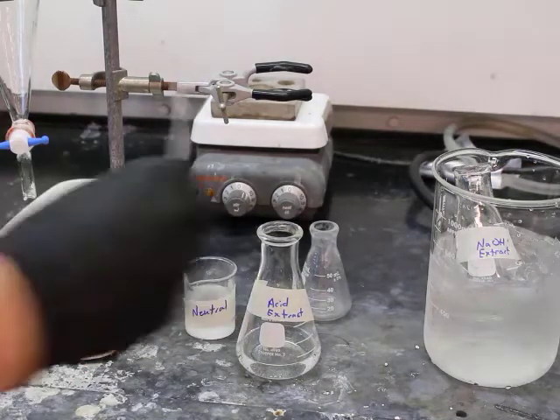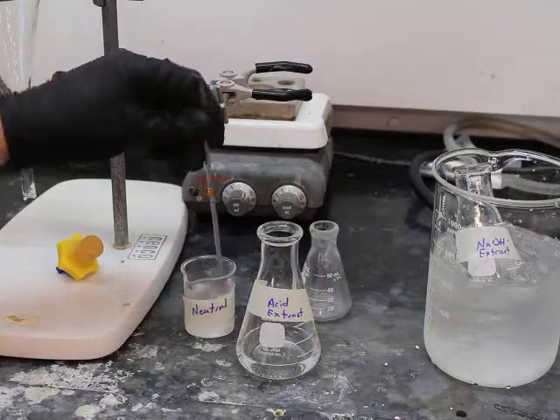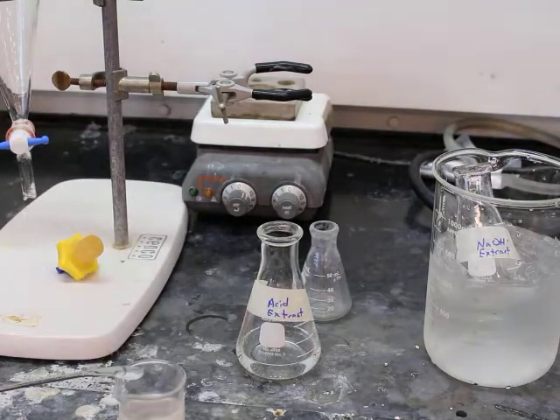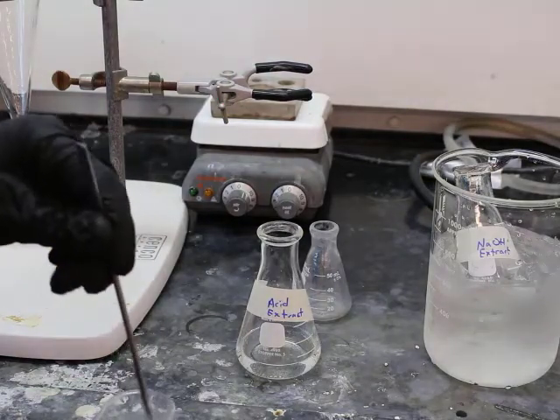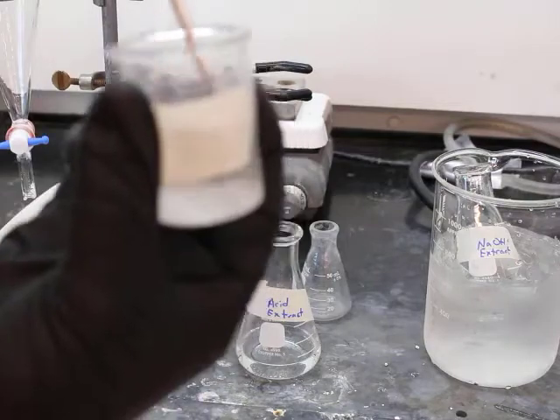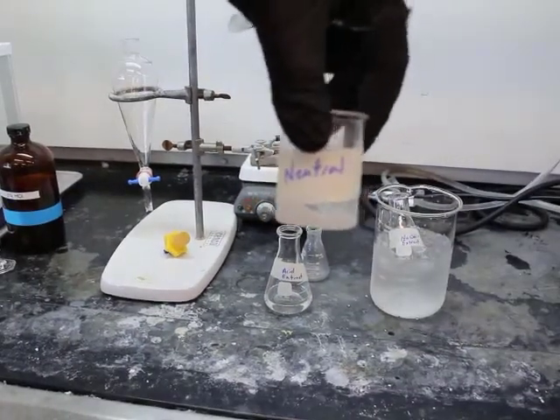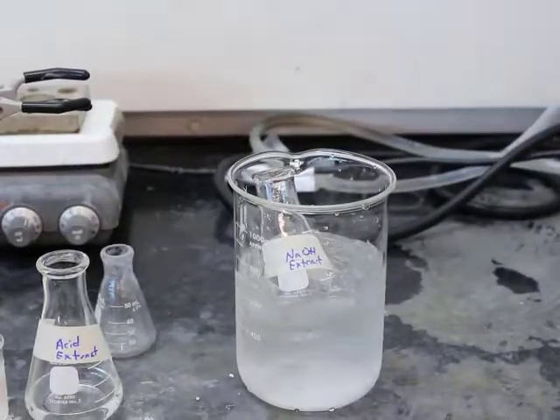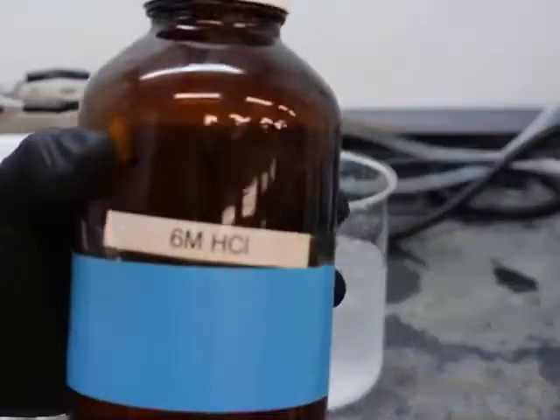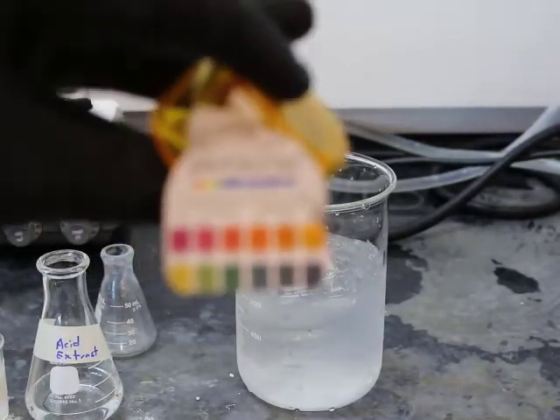And then what you see also in that neutral extract beaker, we have added a drying agent, which is going to be sodium sulfate, right? And that's going to pretty much absorb any water or aqueous anything that got left behind in the organic layer. Okay, and so really you want to add, you're supposed to be able to see it's a little clumpy. You want to add enough sodium sulfate to where you still have a whole lot of fine looking powder.